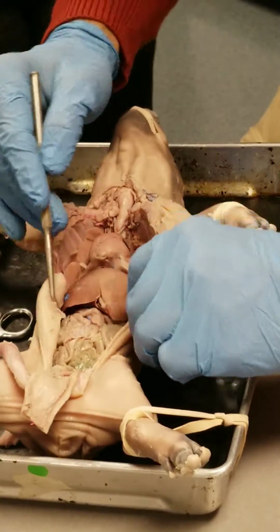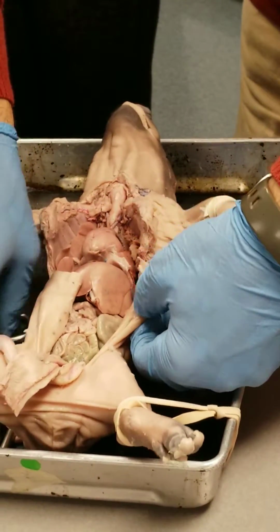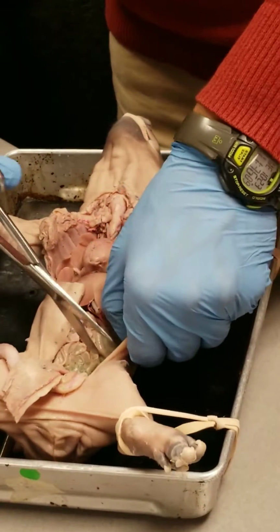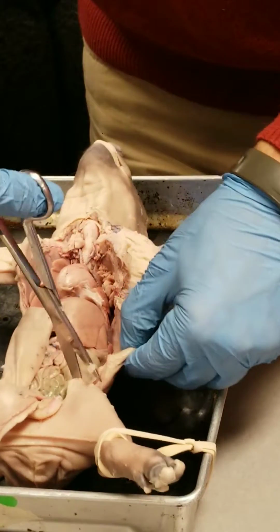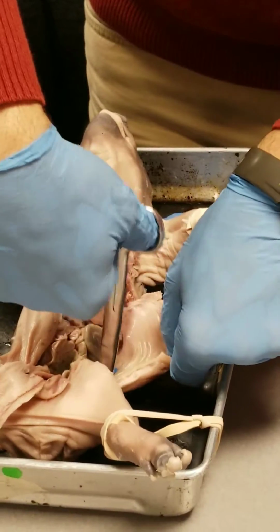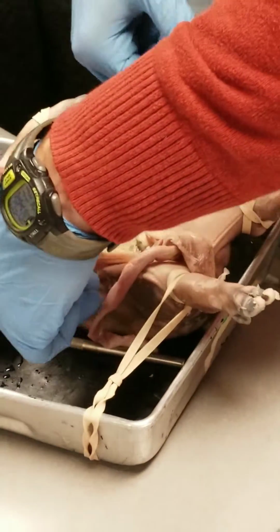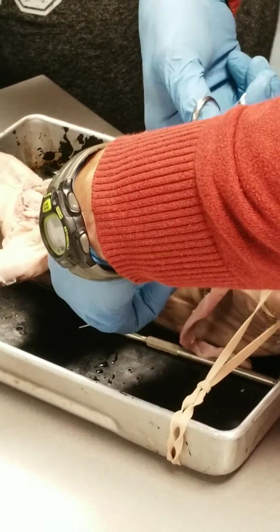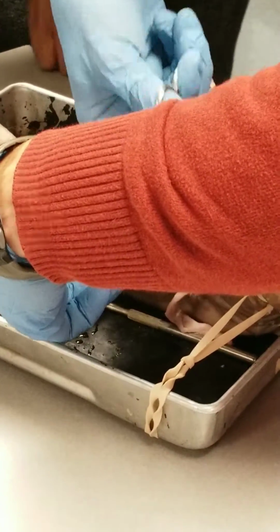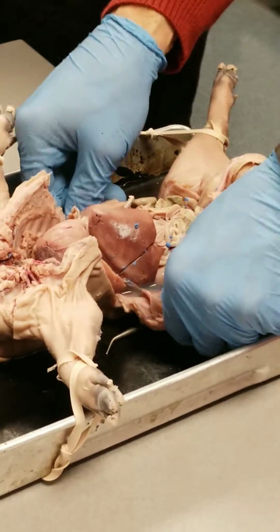But anyway, once you do that, now you've got a little more access. What you can do, again, kind of safely through the body wall, up here just cranial to the hind limbs, is cut down through that body wall. Again, be careful not to cut any of those organs. That'll open it up a little bit more for you. Do the same thing the other way. Hopefully your scissors cut better than mine. That's good enough. Now it's wide open for you.